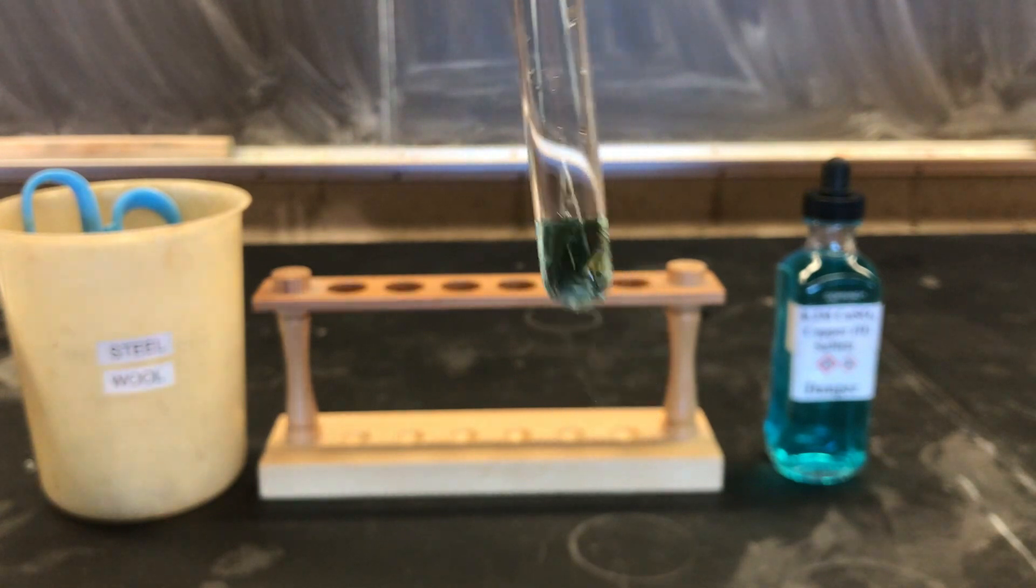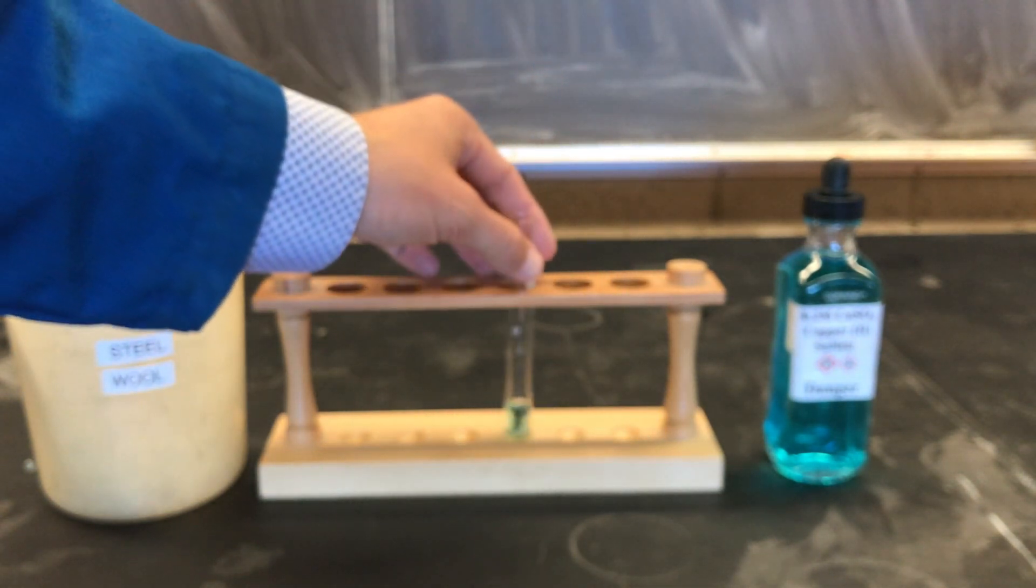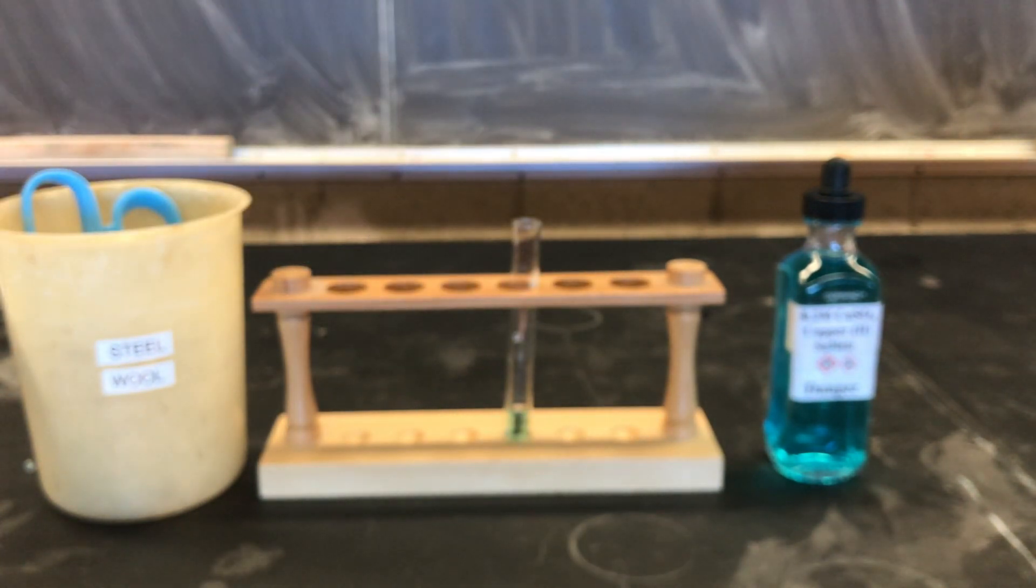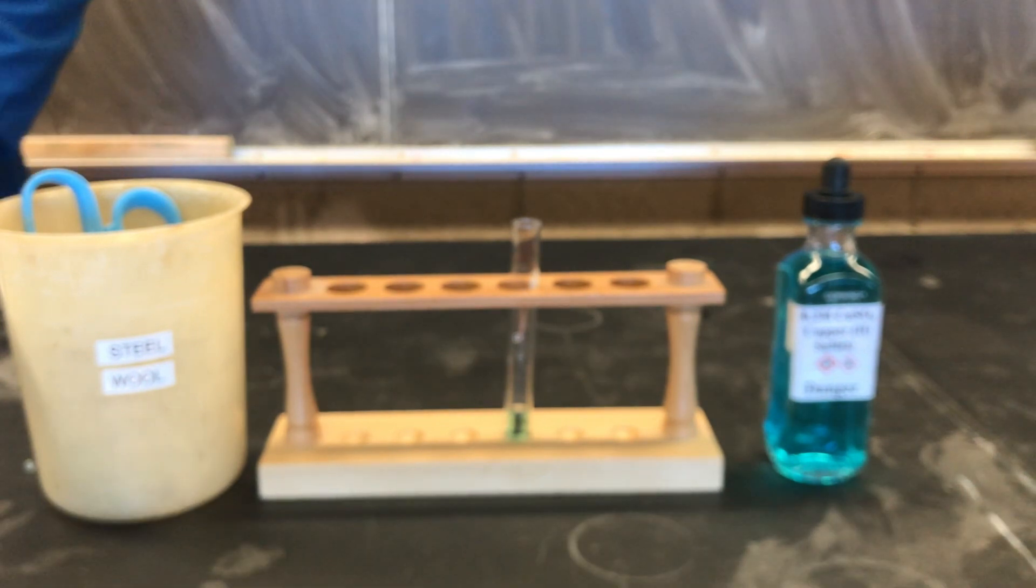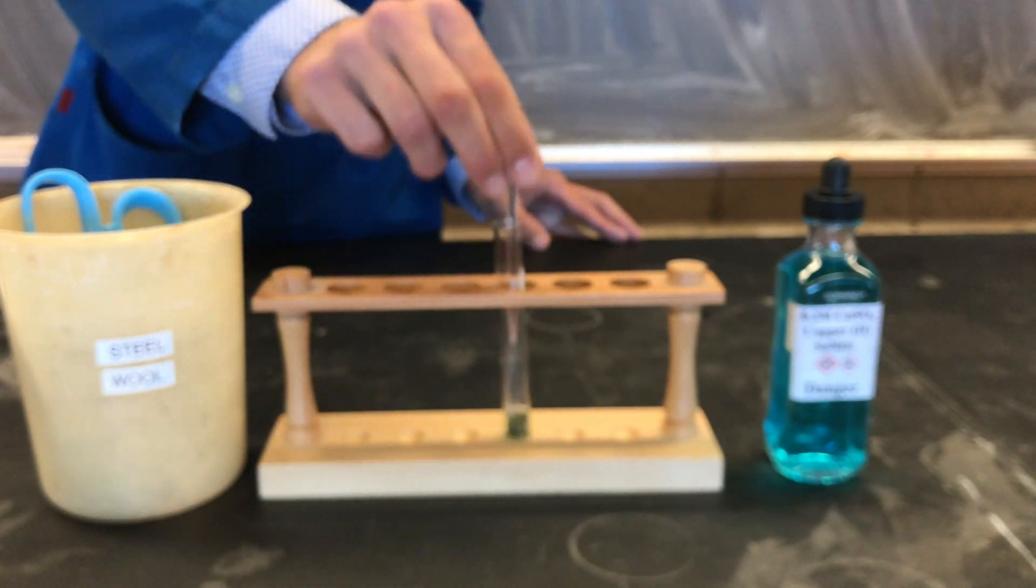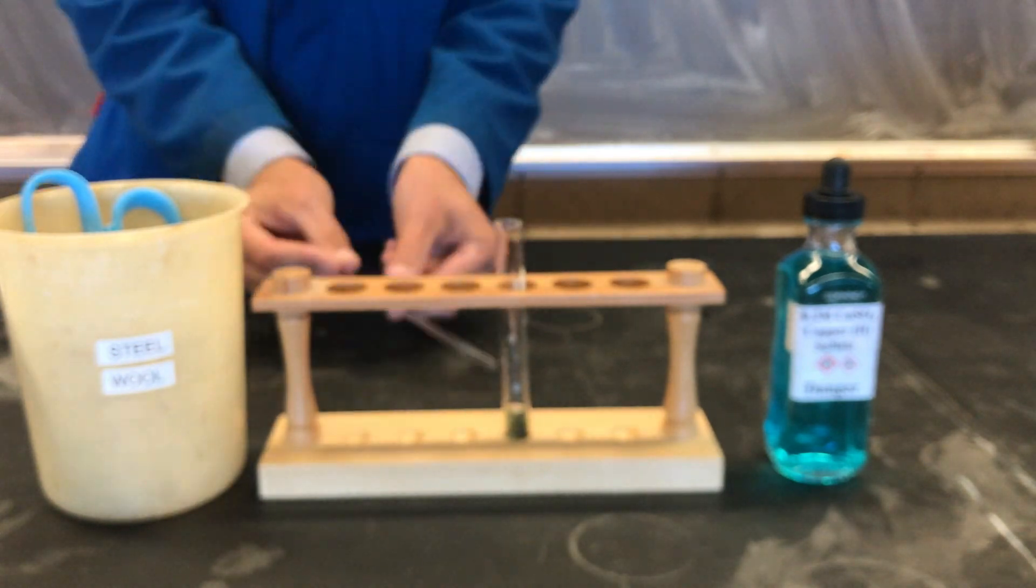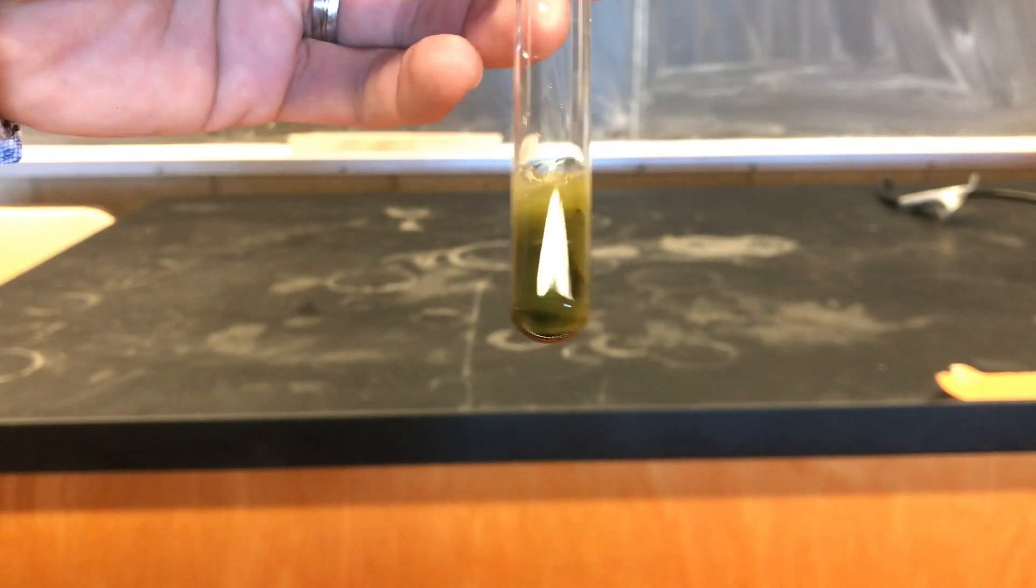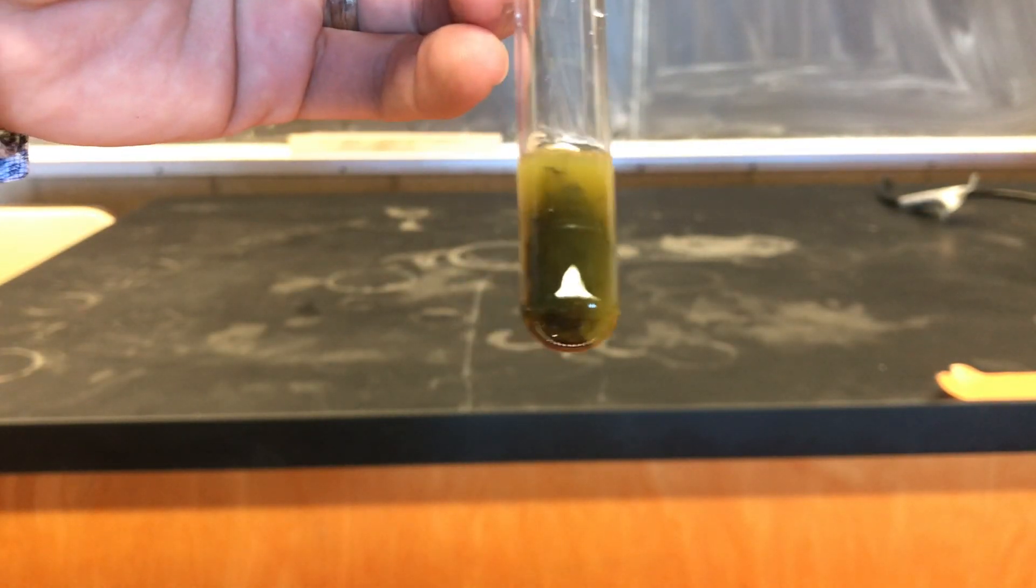We'll let the reaction sit for 10 minutes and stir it with a glass stir rod occasionally. After we're done making our final observations, we'll dispose of our waste in the labeled container and clean our glassware.